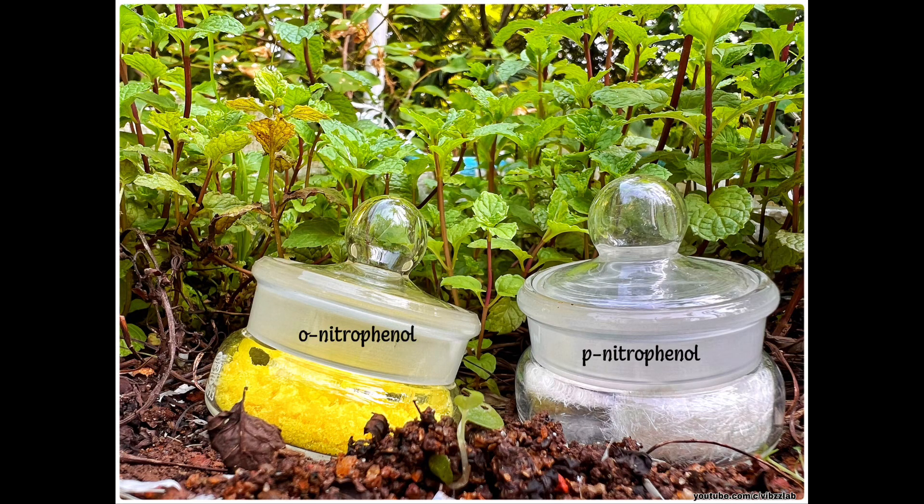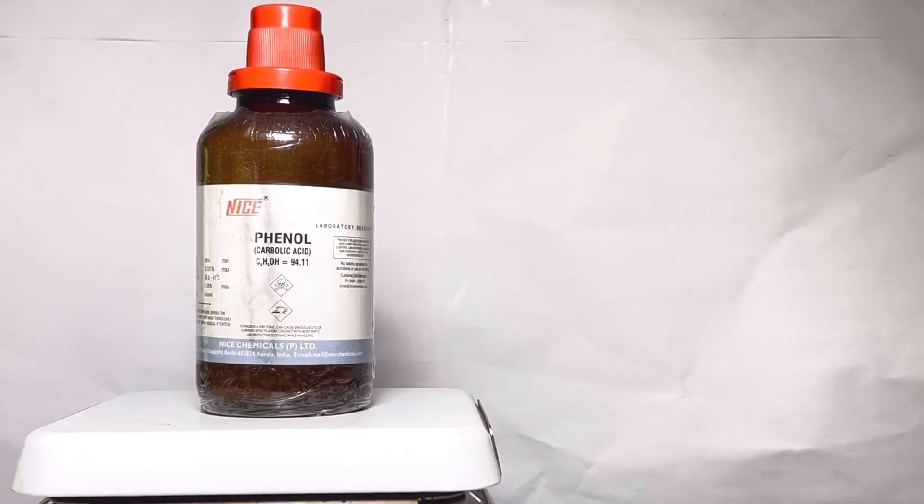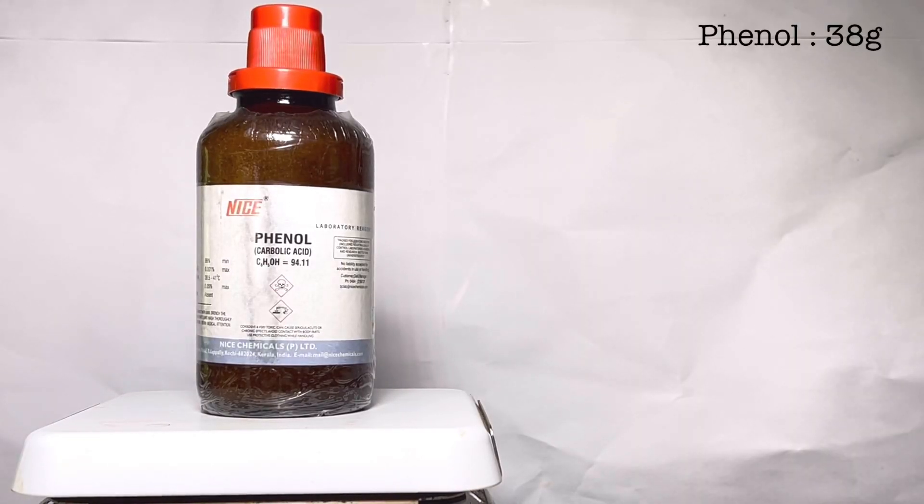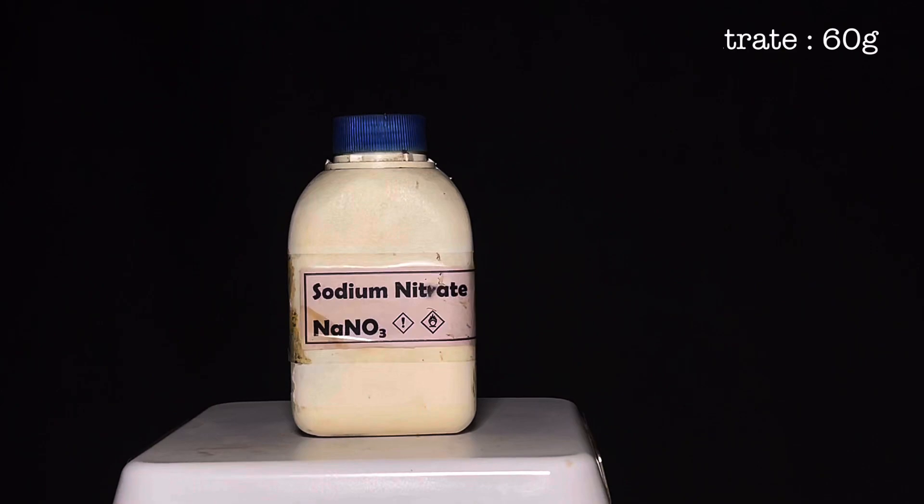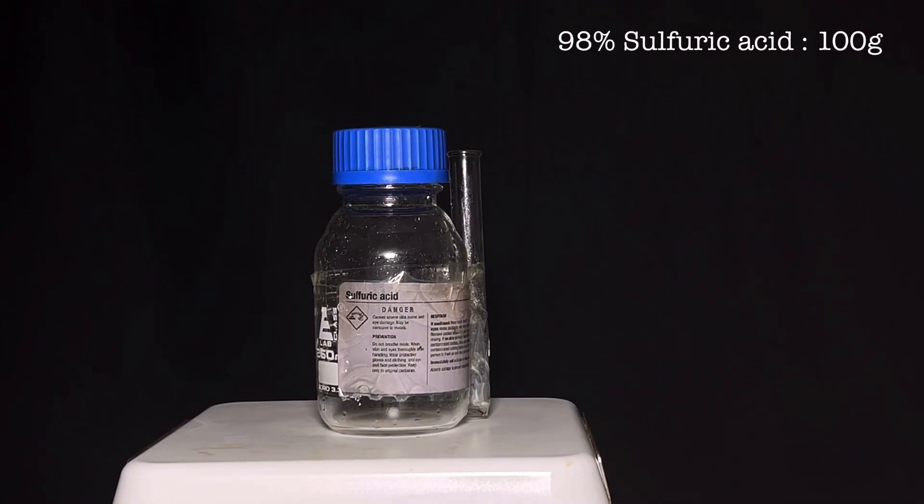Hello friends! In this video, we will be conducting the mononitration of phenol and synthesizing 2-nitrophenol and 4-nitrophenol. For this synthesis, you will need 38 grams of phenol, 60 grams of sodium nitrate, and 100 grams of 98% sulfuric acid.